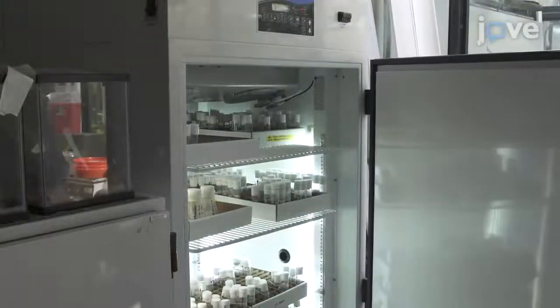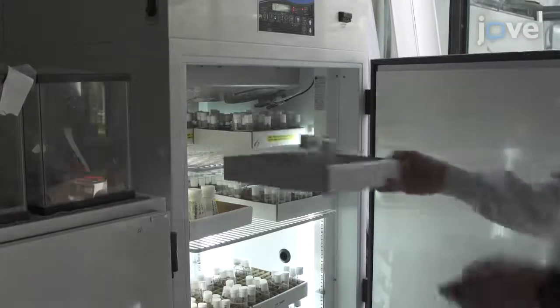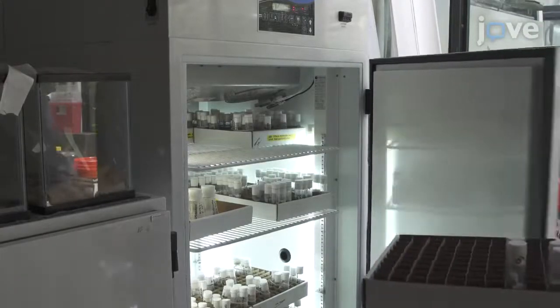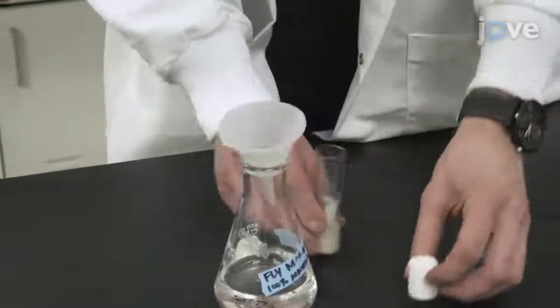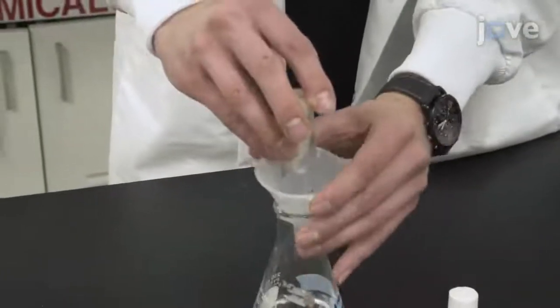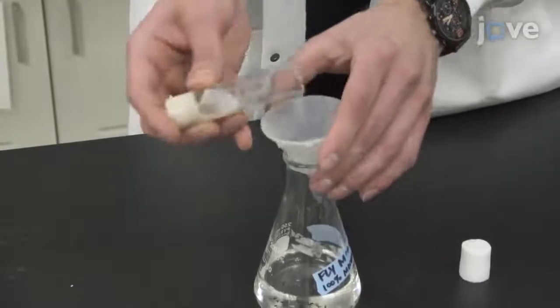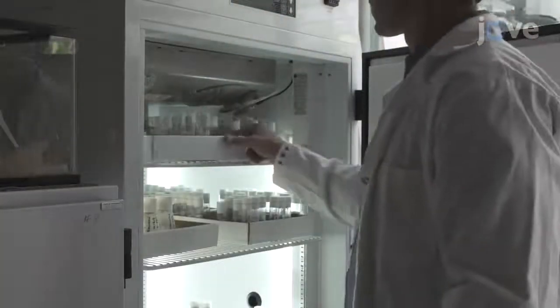Then, incubate the flies under standard conditions for one to four days. After the incubation, discard the adults leaving behind fertilized eggs to mature for testing. Then, return the vials to the incubator.